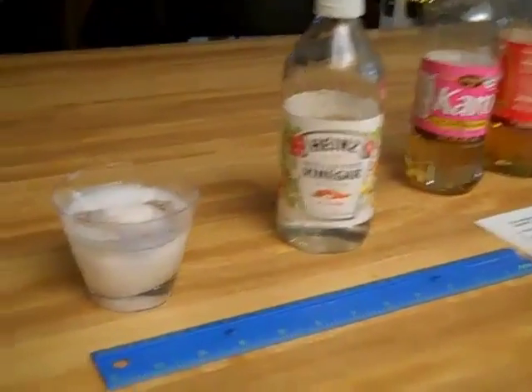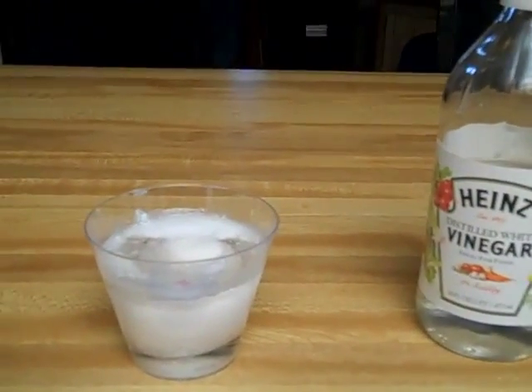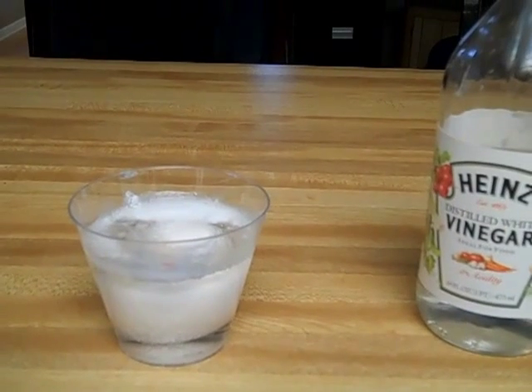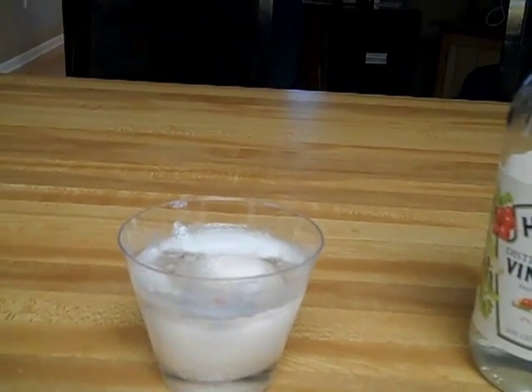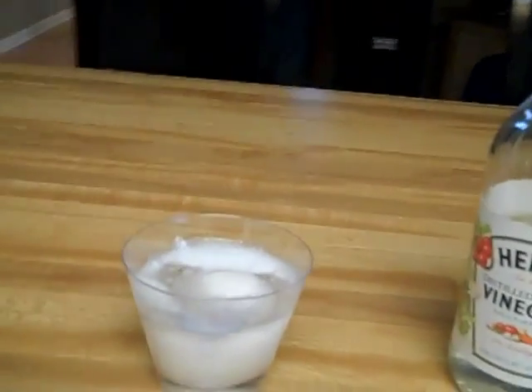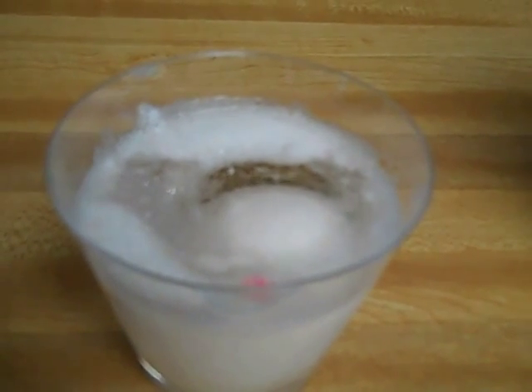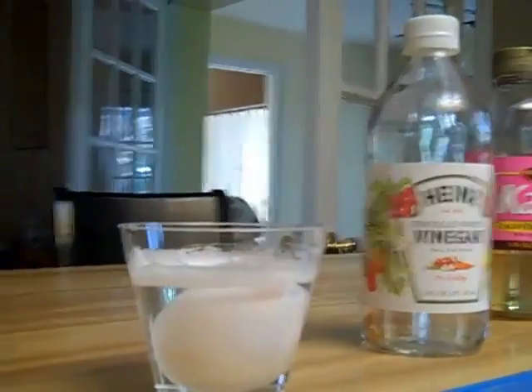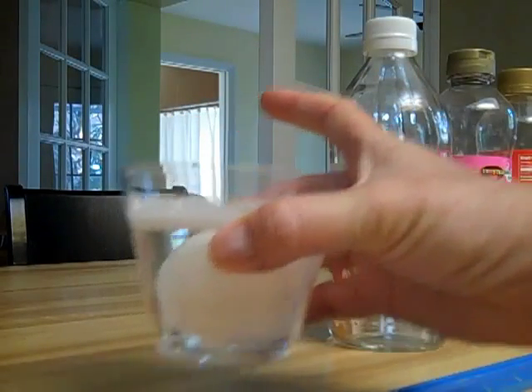We are back after about 15 hours, and the shell has dissolved. We're going to go ahead and take a measurement, and then replace this with water. If you take a look at it, you can see the vinegar has dissolved the shell — all of that scum-looking stuff on top is actually part of the shell. Because vinegar is an acid and the shell is made of calcium carbonate, it actually eats away at the shell. I'm going to go ahead and pour this off first, and then we're going to take a measurement.